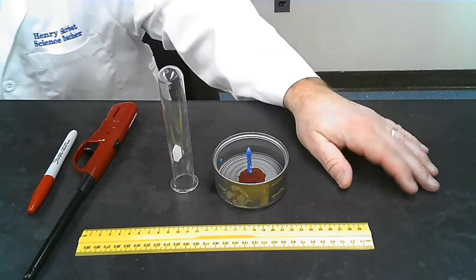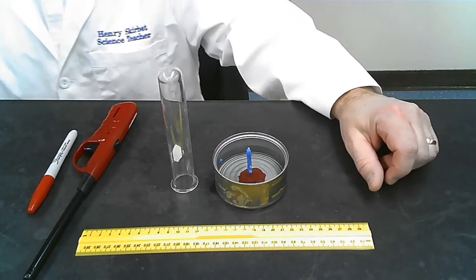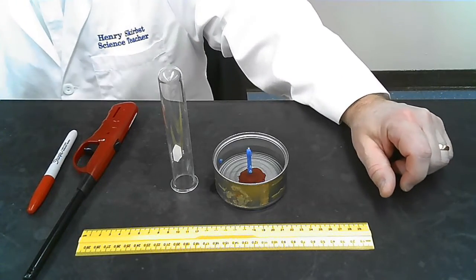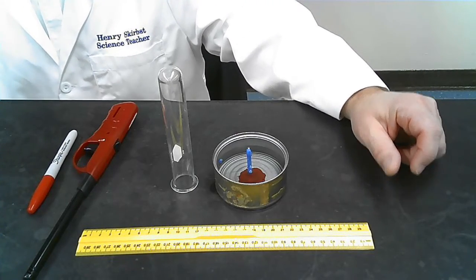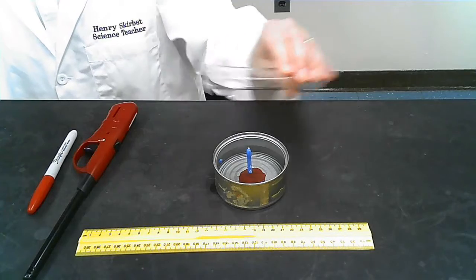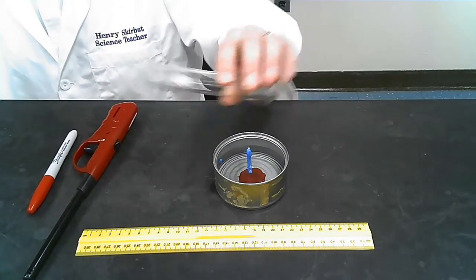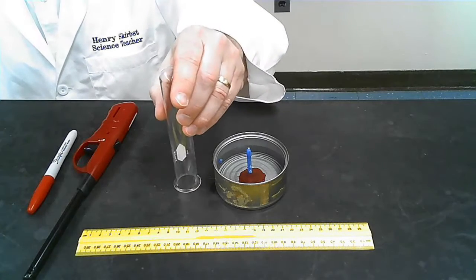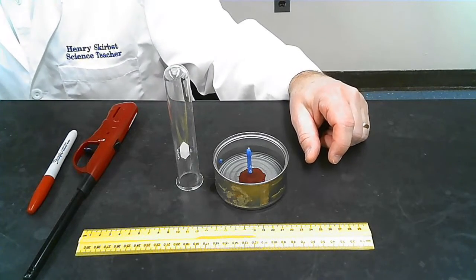And we're going to have to take some measurements as we go through here, and you're also going to be answering some questions. Starting with, what is in the test tube before you place it over the candle? Think about what is in your test tube. And I'll give you a hint. It's the same as what we're breathing right now.